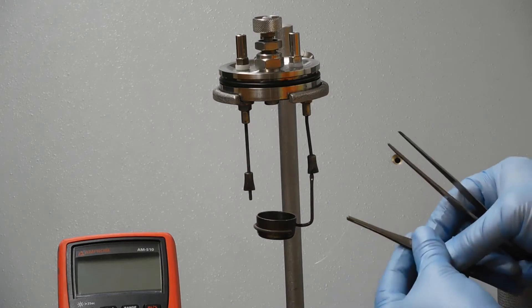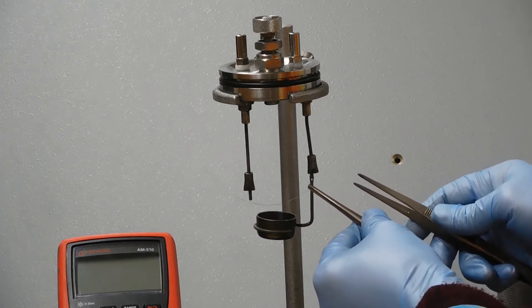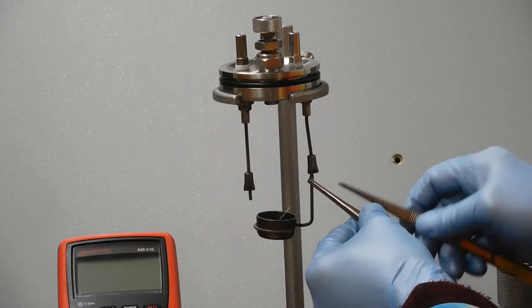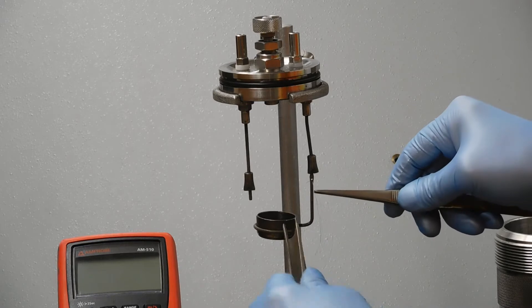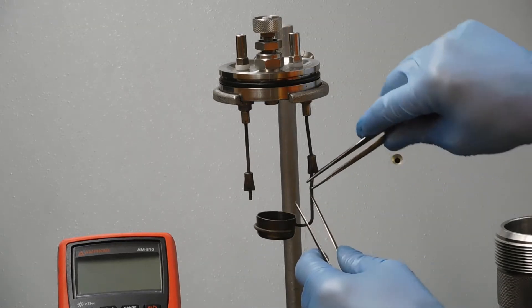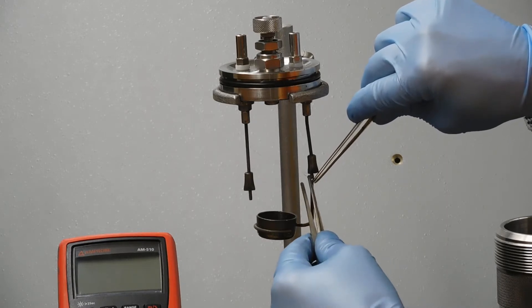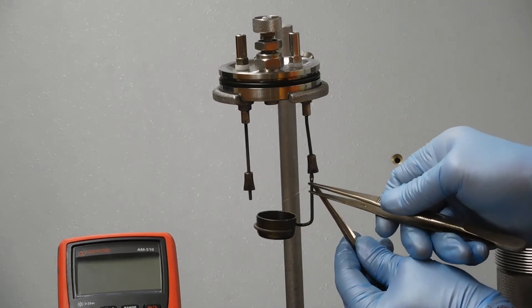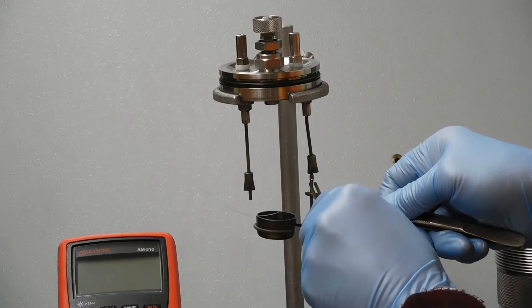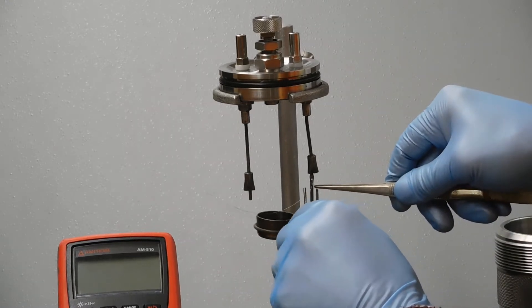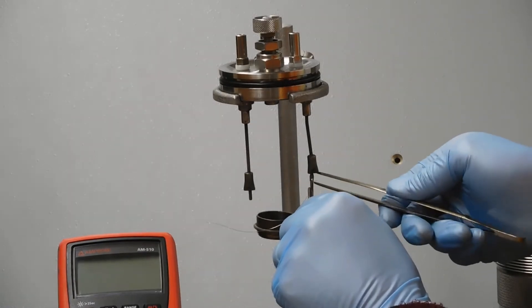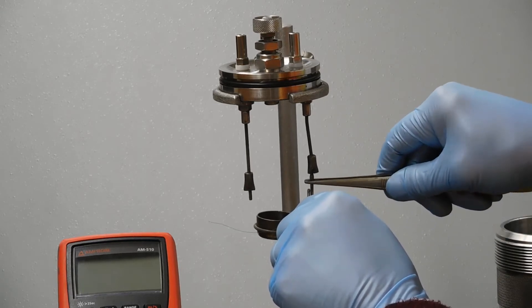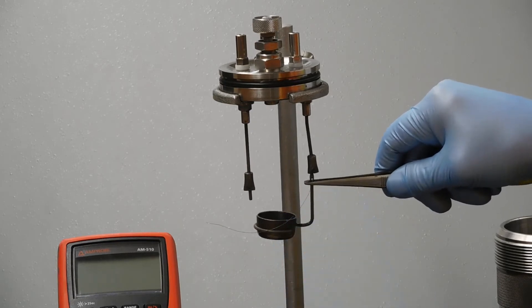I would thread it into here, grab it in the back, and bend it around. You may have to switch which hand and bend it a bit. Grab the back side, pull it around, make sure it's against the thing, pull this down on top of it. Now you've got the wire in good contact with itself, and you need to do the same thing on the other side.